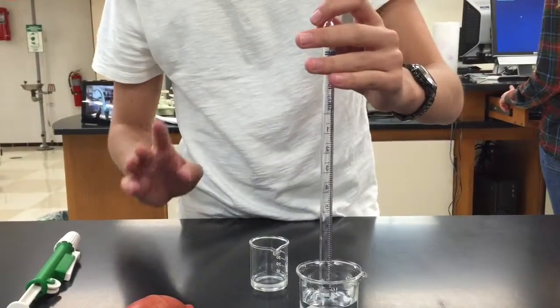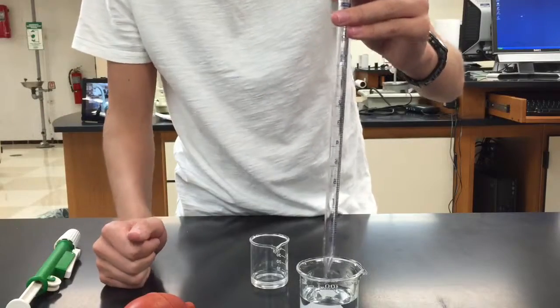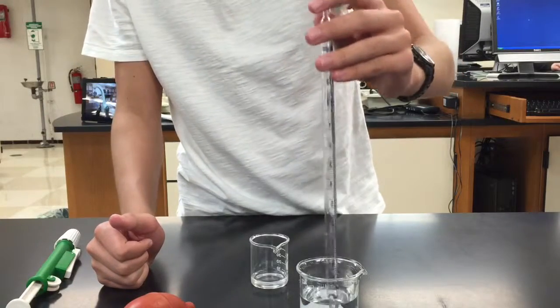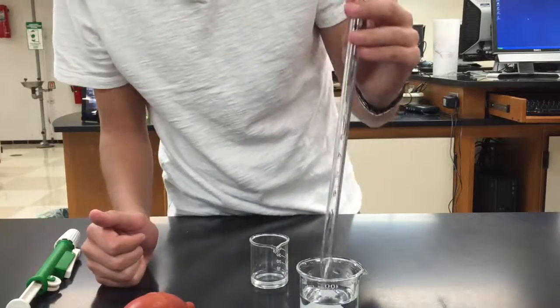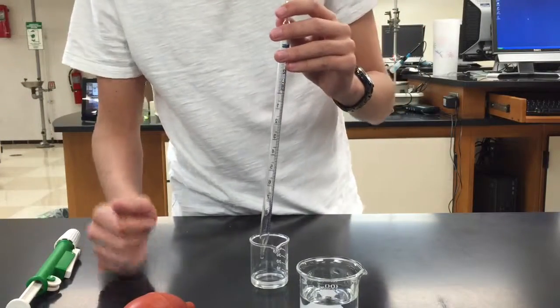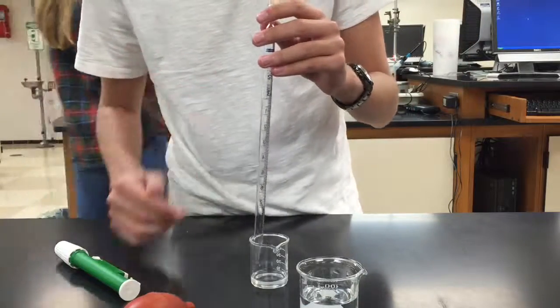Make sure a lot of people forget to do the second rinsing just because it's like, okay, it's not going to affect it that much. It will because it'll dilute your solution and screw up your experiment. I can speak from experience on that. Make sure you wash everything afterwards and do the rinsing process every time you use a new solution.